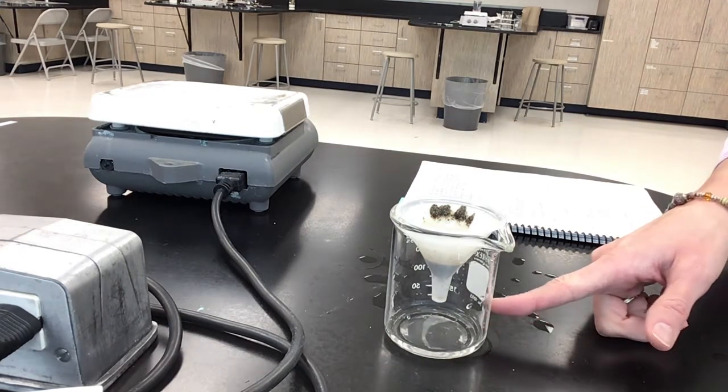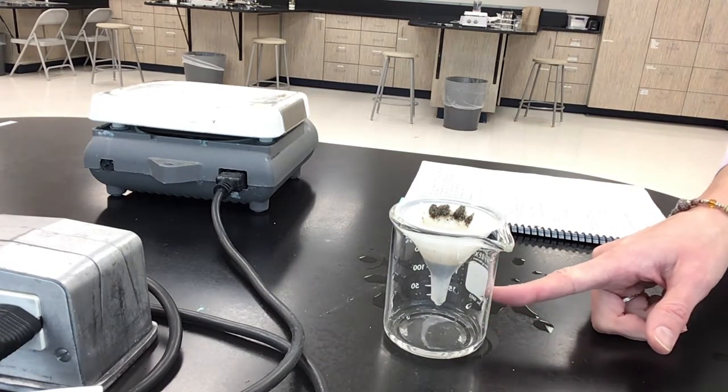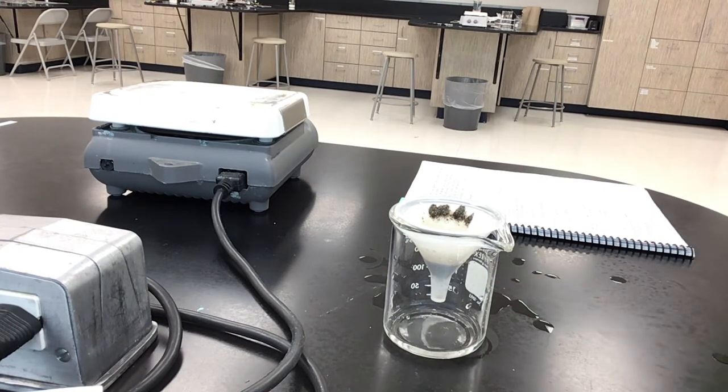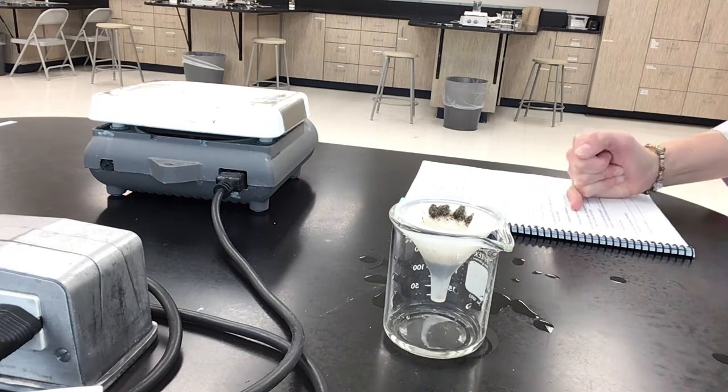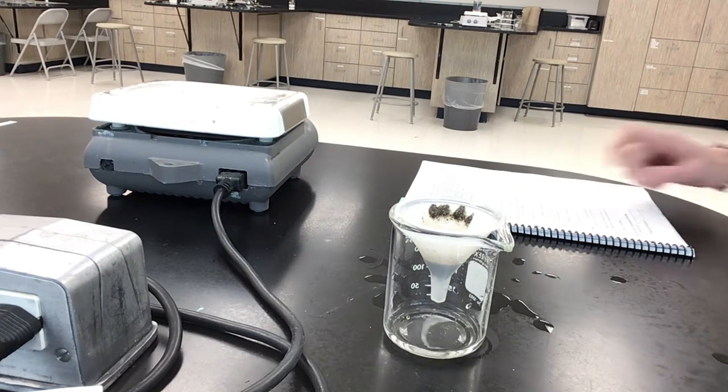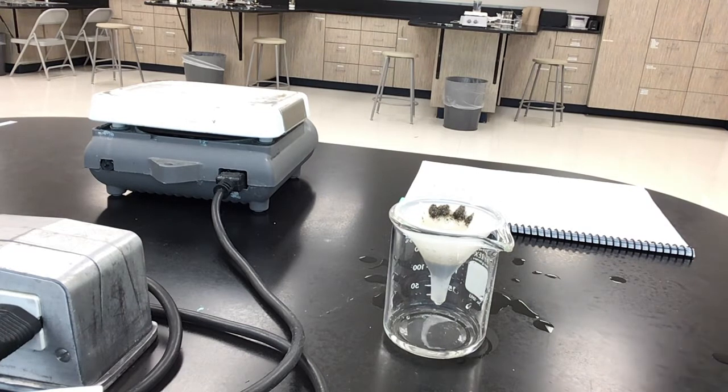So, this is our beaker, if you need help remembering that one. And how do we know? And so you're going to maybe look back and see what we had mixing together in part 1 and part 2, where we had our salt and sand, and then we added water to that. That's kind of what you're wanting to look at. So we're going to continue to just let this filter out a little bit, and then we'll move on to the next step.